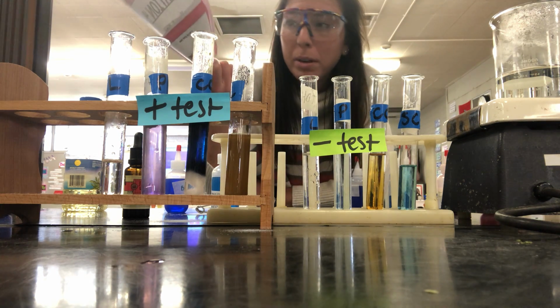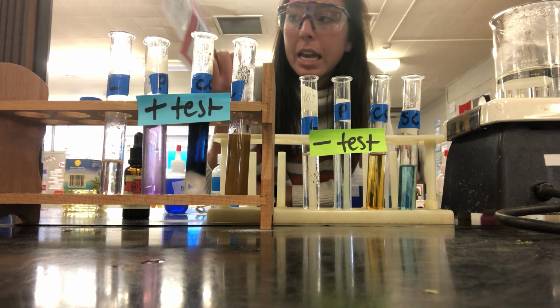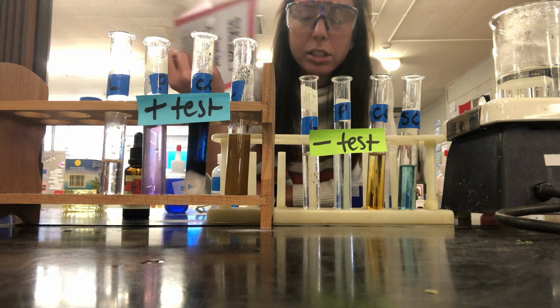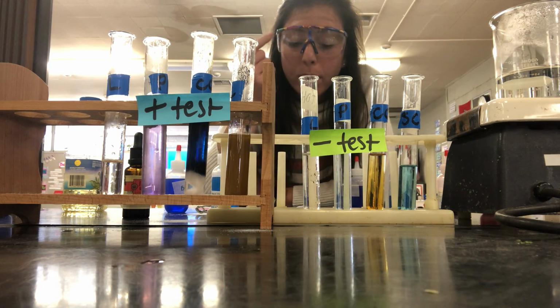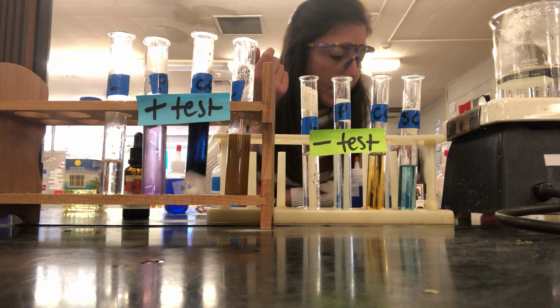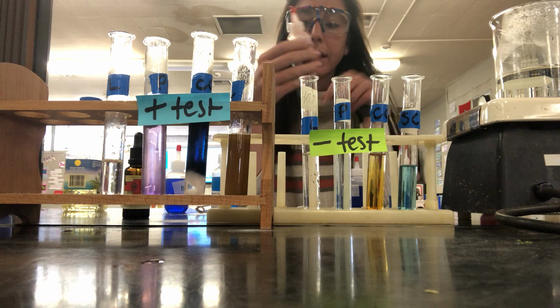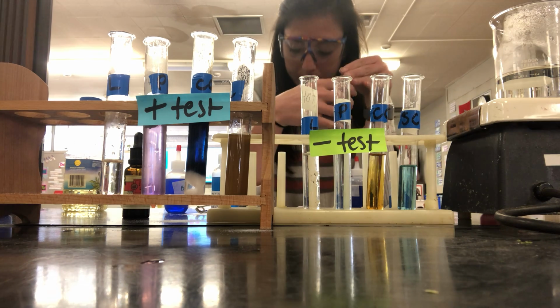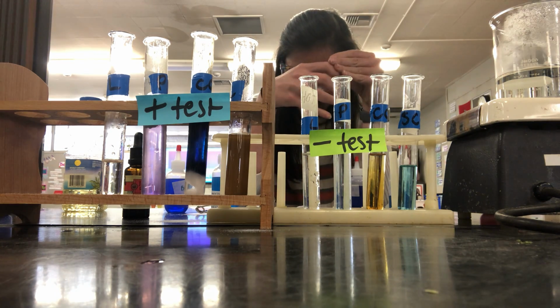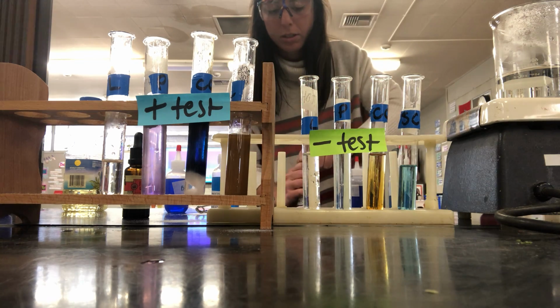Now this one also can stain, and it's actually called Sudan 3 stain, and it can cause a lot of eye irritation. So again, the goggles are going to be so critical tomorrow. They need to stay on your face the entire time. So Sudan 3 is a red color. It will stain your clothes like crazy, so be very careful with this one. And what you're going to do is add 6 drops of Sudan 3 to your tubes.